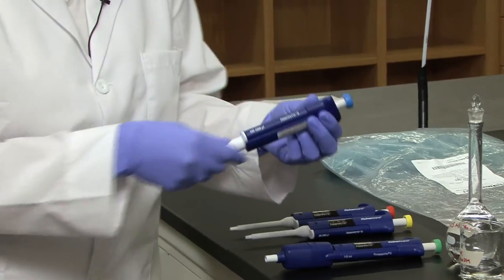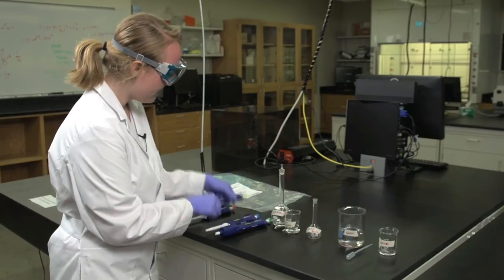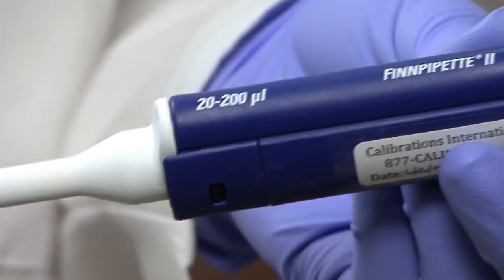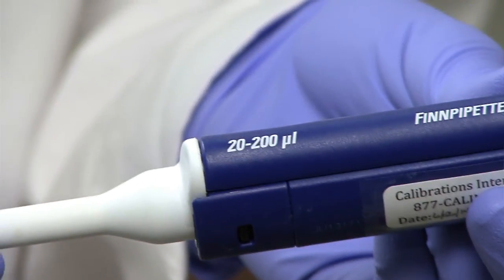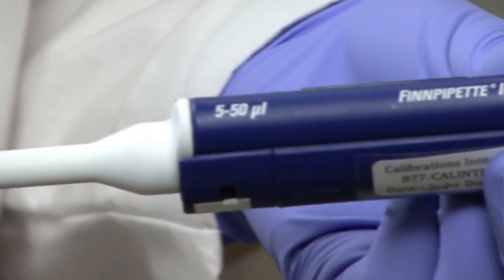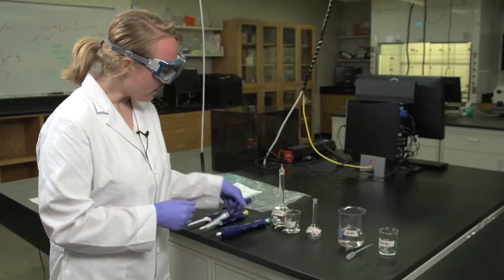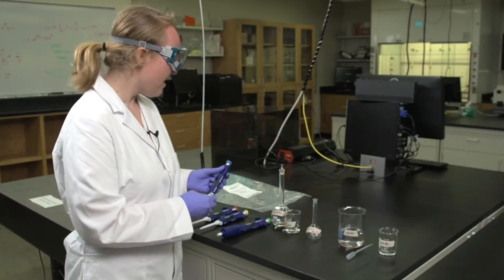We have also got the 100 to 1000 microliter micropipette, the 20 to 200 microliter micropipette, and then the 5 to 50 microliter micropipette. I am going to demonstrate using the 100 to 1000 microliter pipette today.